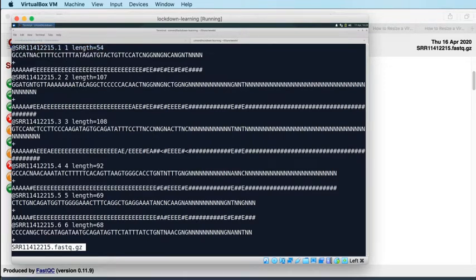The second line is then the sequence data itself. So these are your A's, T's, G's, C's, and N's, which make up your called bases from this sequencing read. So this is your data effectively on this line.